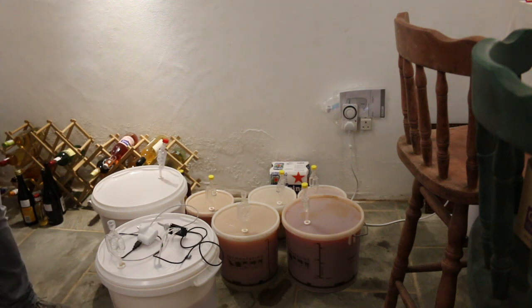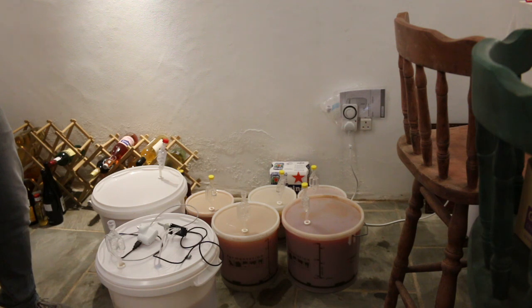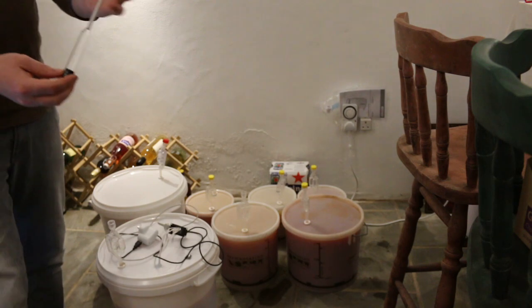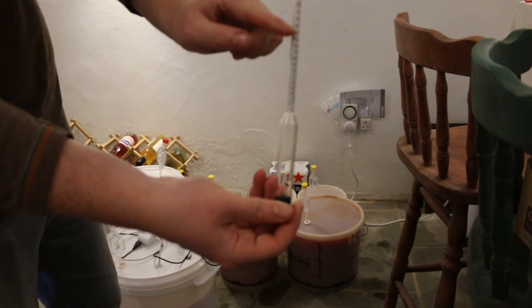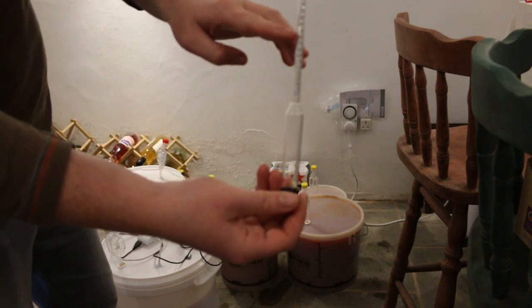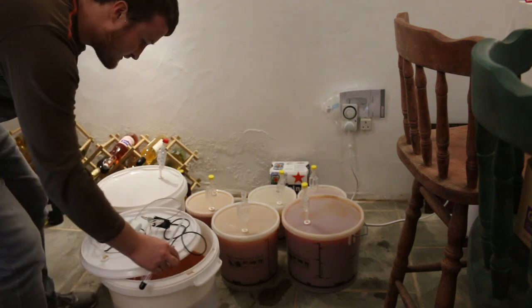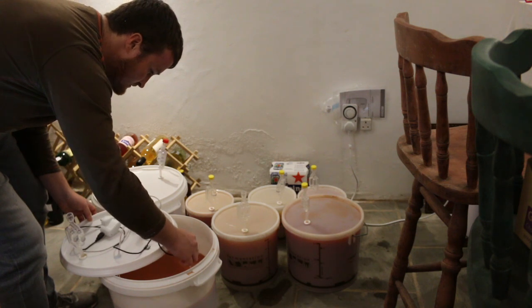Alright, nice to go. Yeah, I was hoping to do a close-up shot of this, but I'll have to wait for the day. Very simply, the way this works is you drop this in the water and you just read at whatever point it is around here. So I suspect this is going to be, because I've not added sugar or anything to it, probably around the 50-60 range. But a little closer look now. So here we go. I sterilized this beforehand, so don't worry.